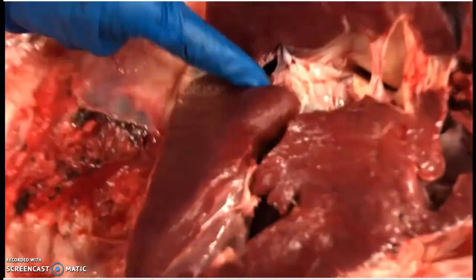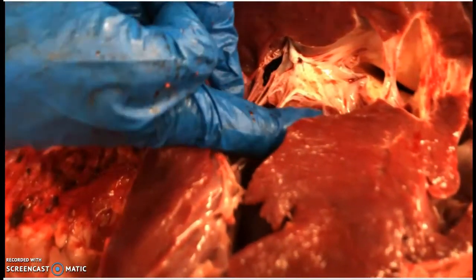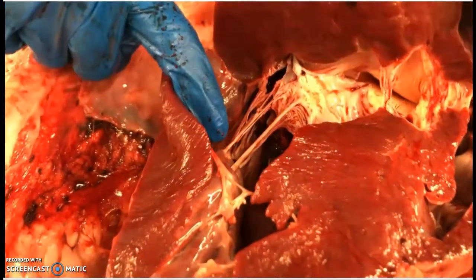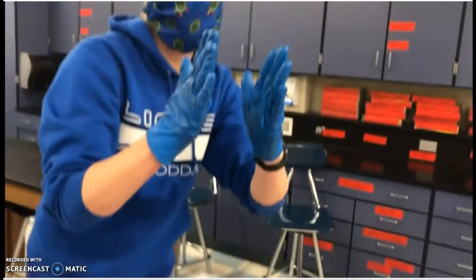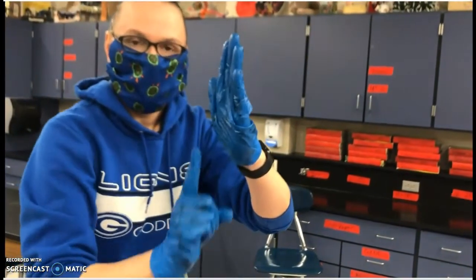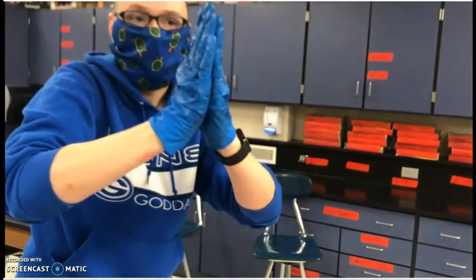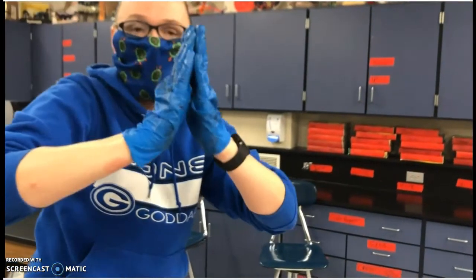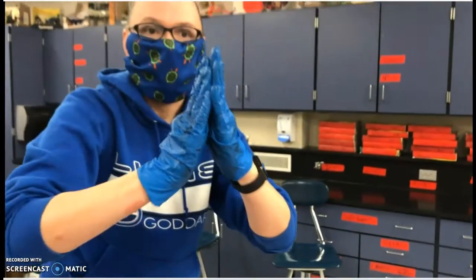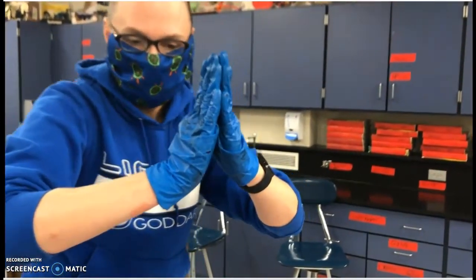Inside here, these are the chordae tendineae. These help to hold the valves in place so that the valves don't flip back and forth. A valve is a one-way passage — blood is going to be flowing one way. When the ventricle contracts, I don't want blood to flow backward. Those cords help keep the valves from inverting, because if your valve flips the wrong way, it's not going to prevent any backflow. So those cords help to hold it in place.